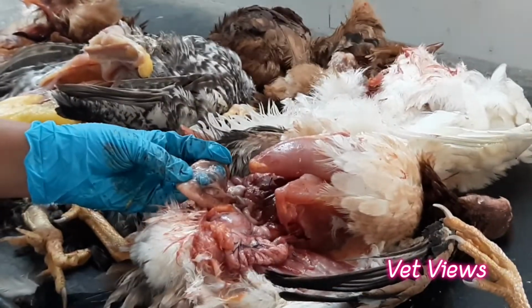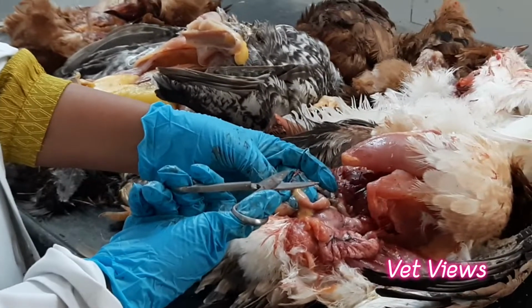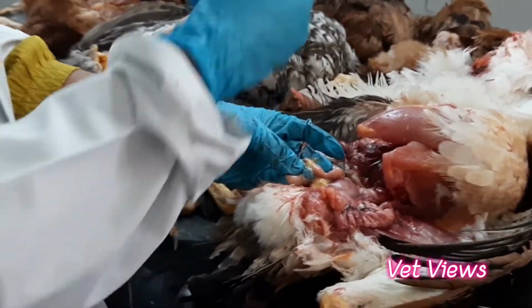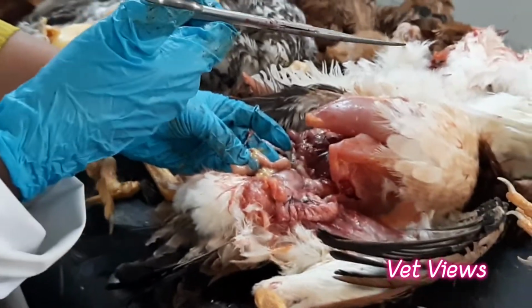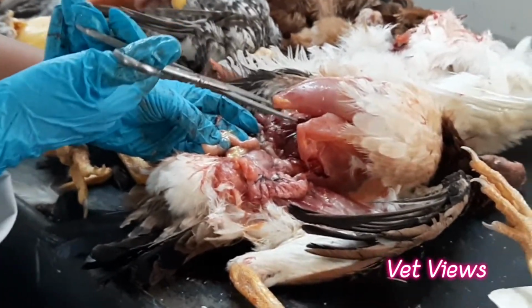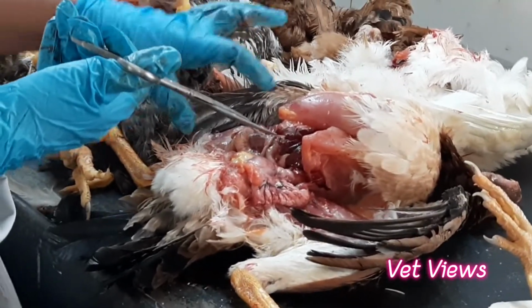In case of enteritis, the contents will be too watery with a greenish discoloration. This is the normal color. In necrotic enteritis, when you open the intestine, there will be hemorrhages inside and the texture also changes. The condition is called Turkish towel appearance. That will be there in necrotic enteritis, in clostridial infections, and E. coli infections also. So you have to check the internal consistency of the mucosal membrane in the small intestine.